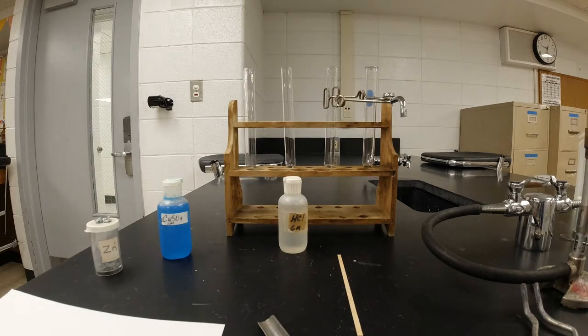If you listen, I'm going to explain some things here, but the big thing is you're going to see examples of chemical reactions, and you're going to get some practice balancing equations, writing names, which we did last semester, and then deciding what type of reaction occurs. All right, so let's get started with the first one here. You get to see some different types of reactions. So let's start with the first one.